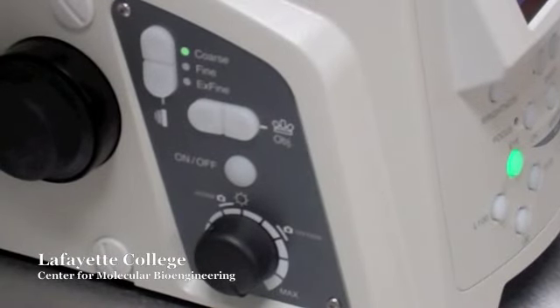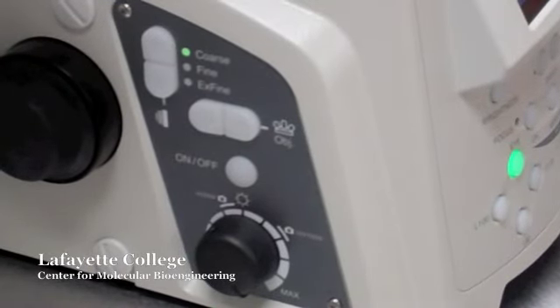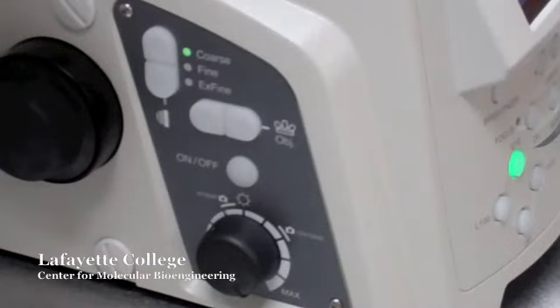Once the sample is focused, turn off the transmitted light using the off button to the left side of the microscope.